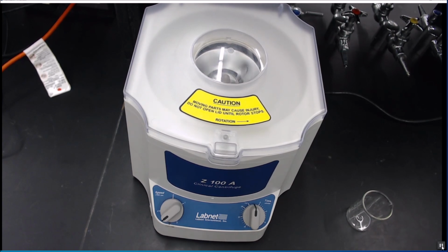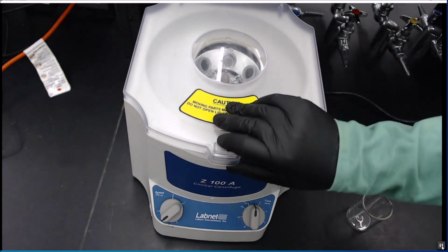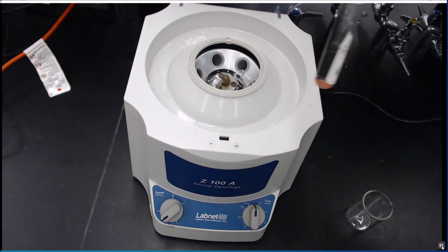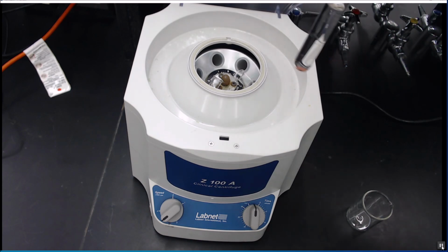So our centrifuge has finished its run. We will let it come to a complete stop. These are not the fancy ones that have brakes, but you see now it is stopped. You can open up the lid. We are at position 1. And you can see that the copper is a lot more squished down into a pellet. You can actually see it move a little bit.